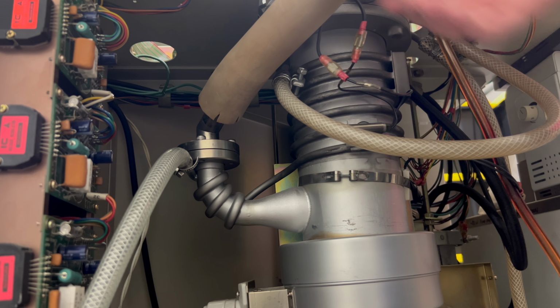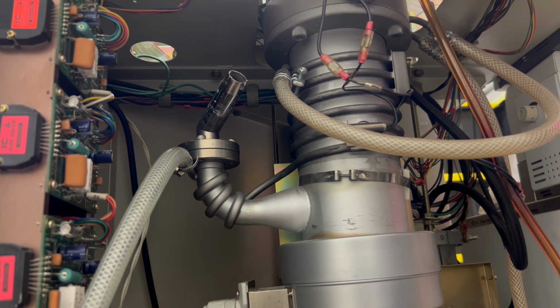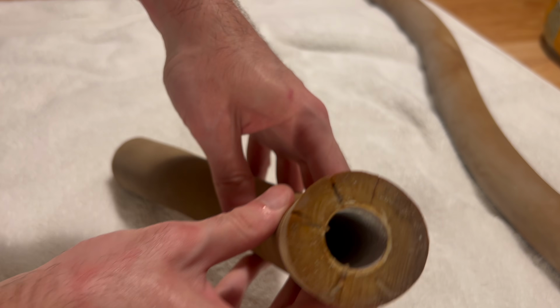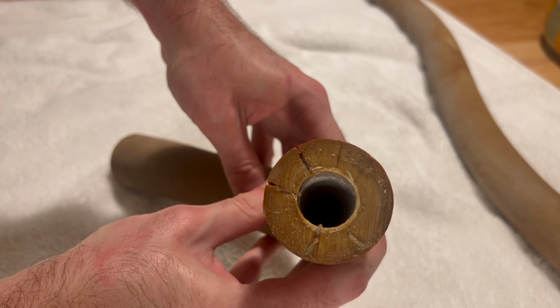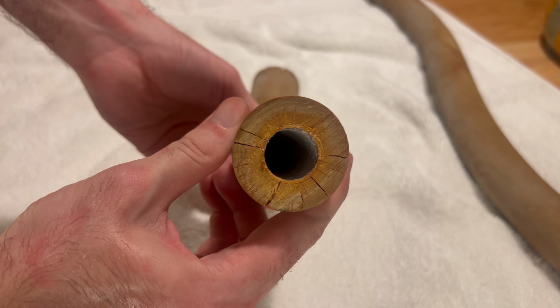I measured the inner and outer diameter of the hose, and unfortunately, I wasn't able to find an exact replacement. The hose fittings are 24 millimeters, which is not a standard size. To add insult to injury, replacement rubber hoses like this are quite expensive. A few feet of hose would be over $200, which is a bit more than I want to spend since at this point I'm not even sure the microscope will function at all.